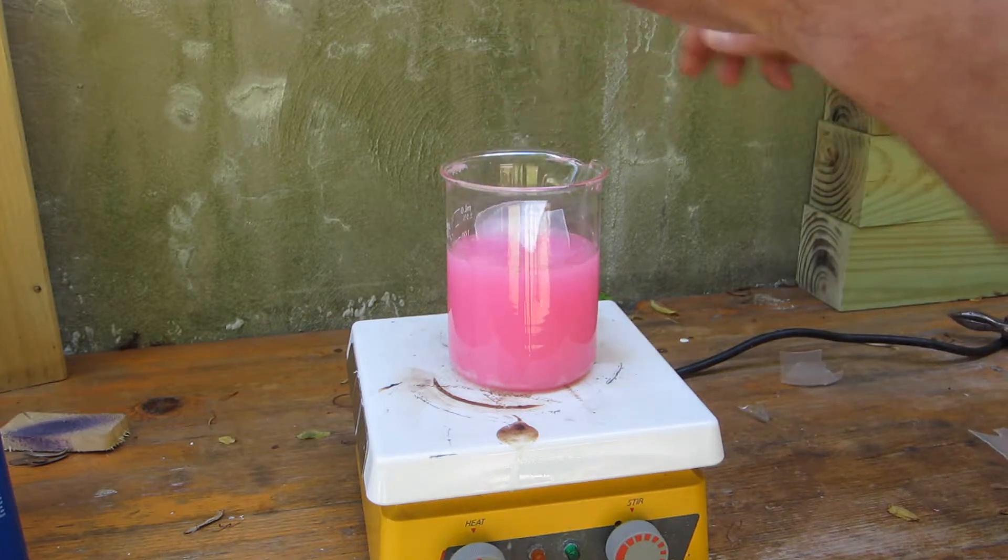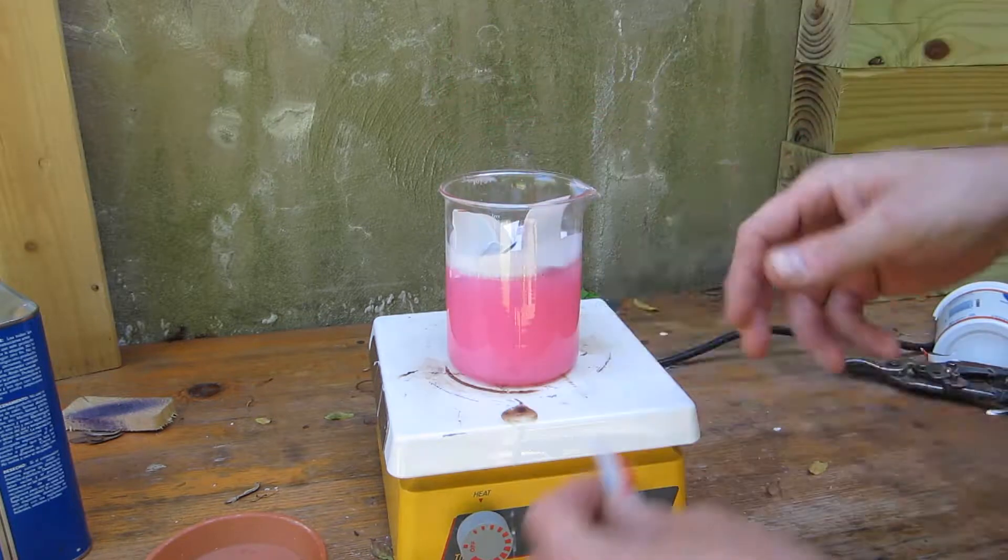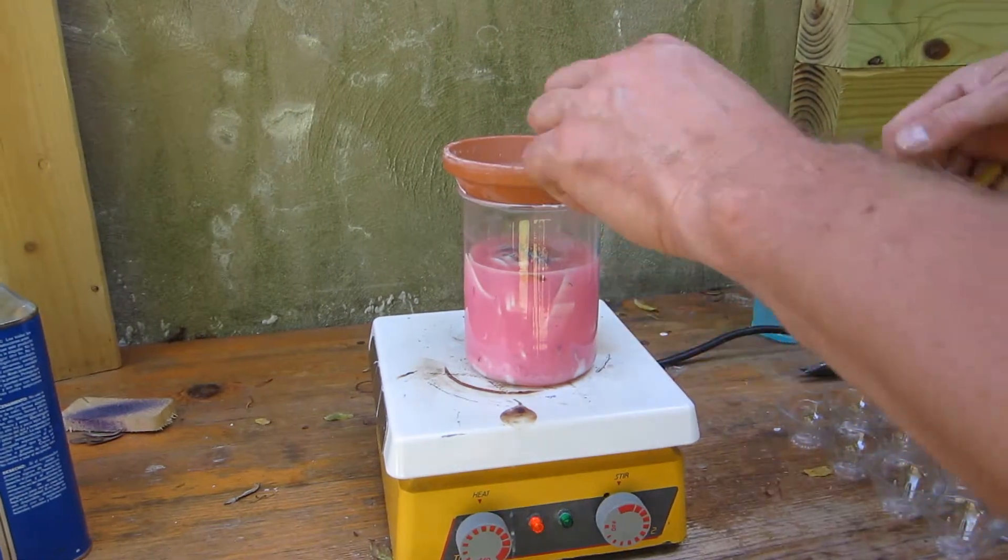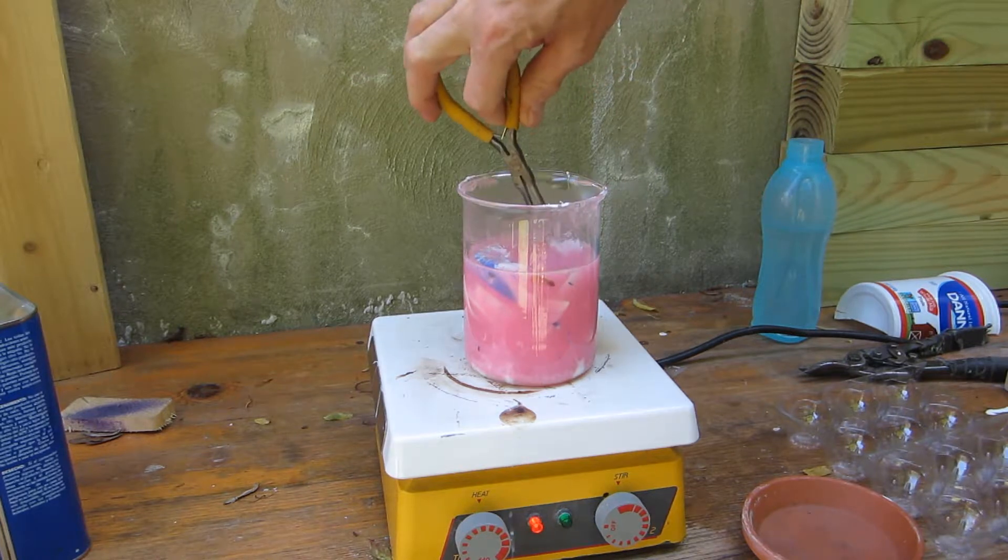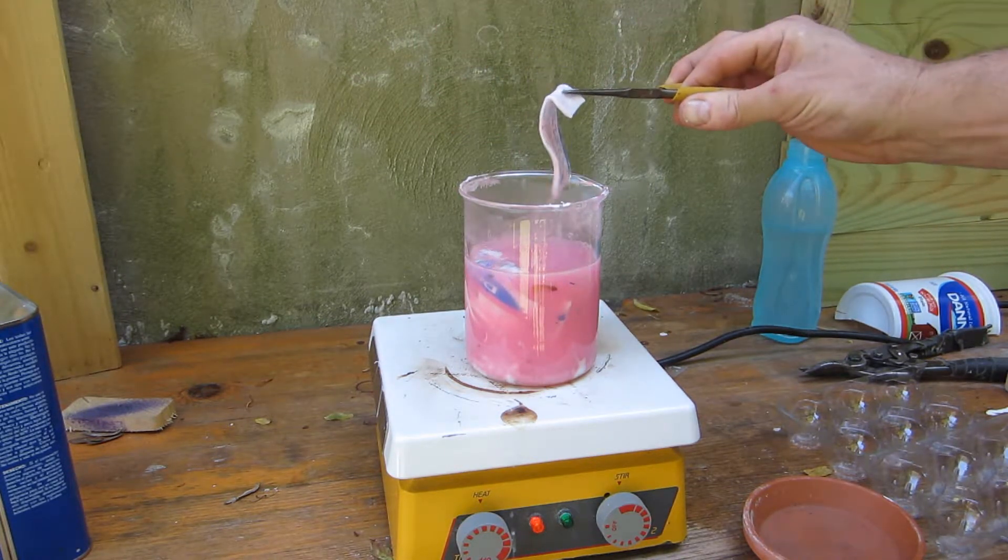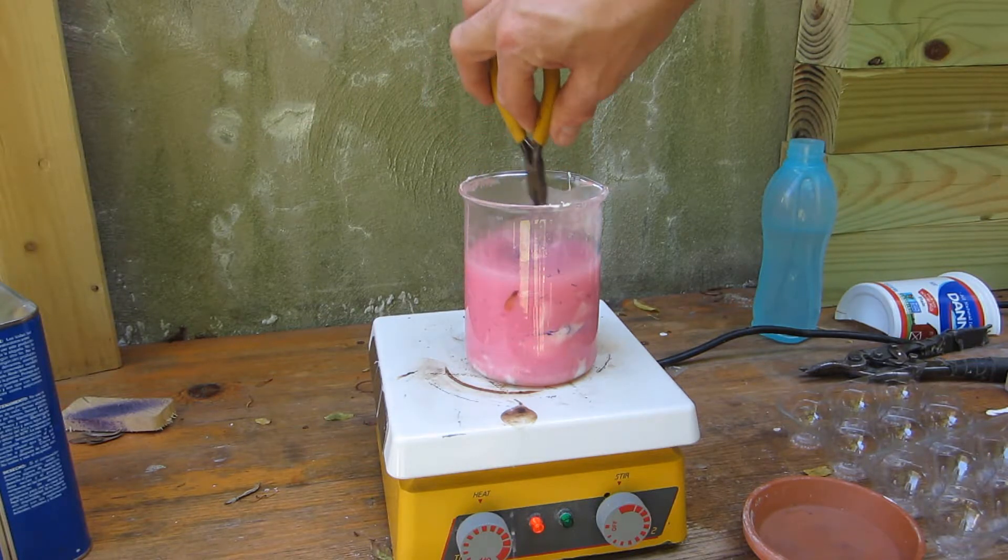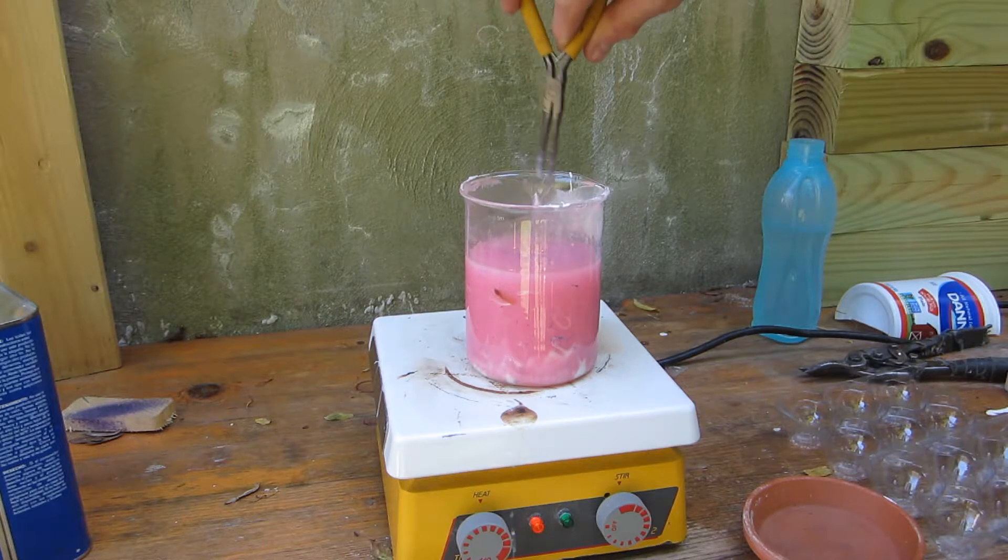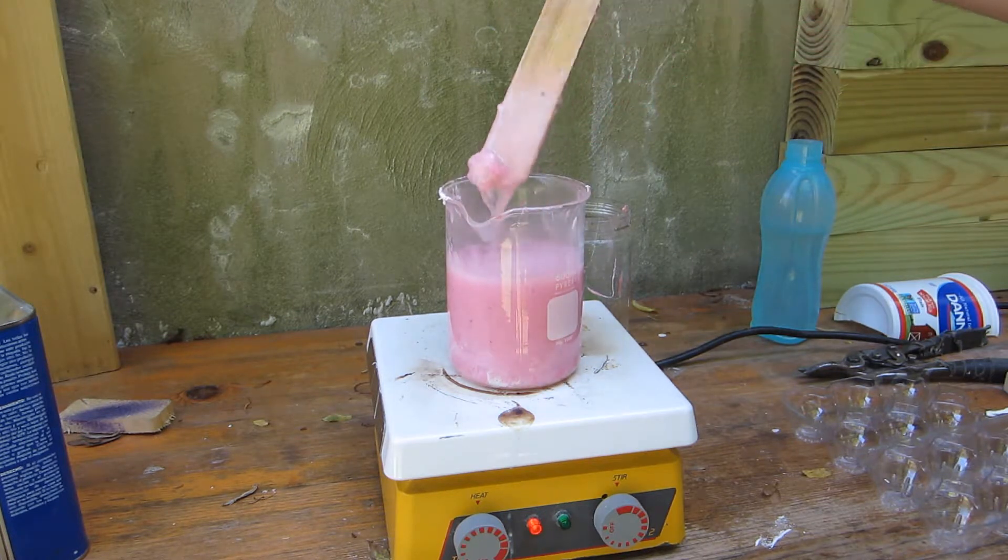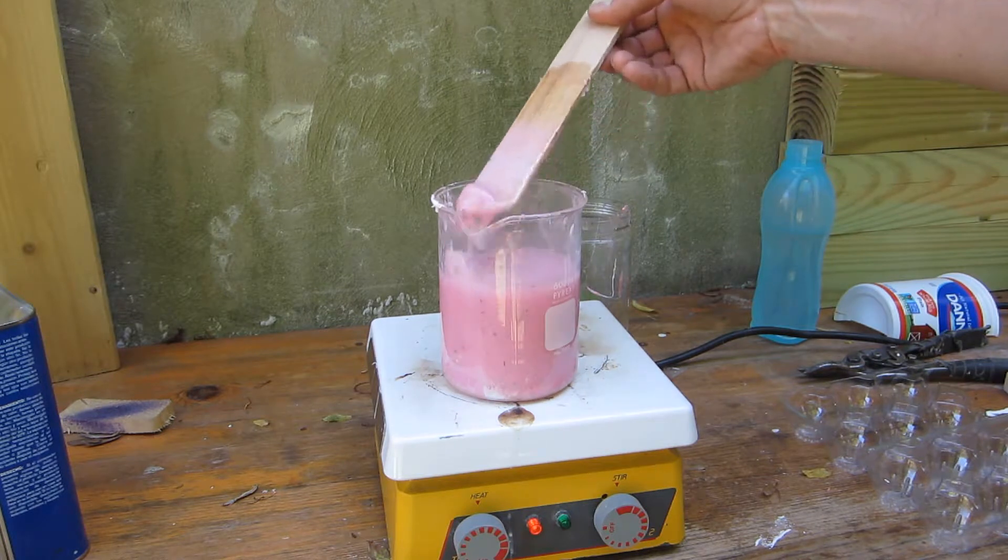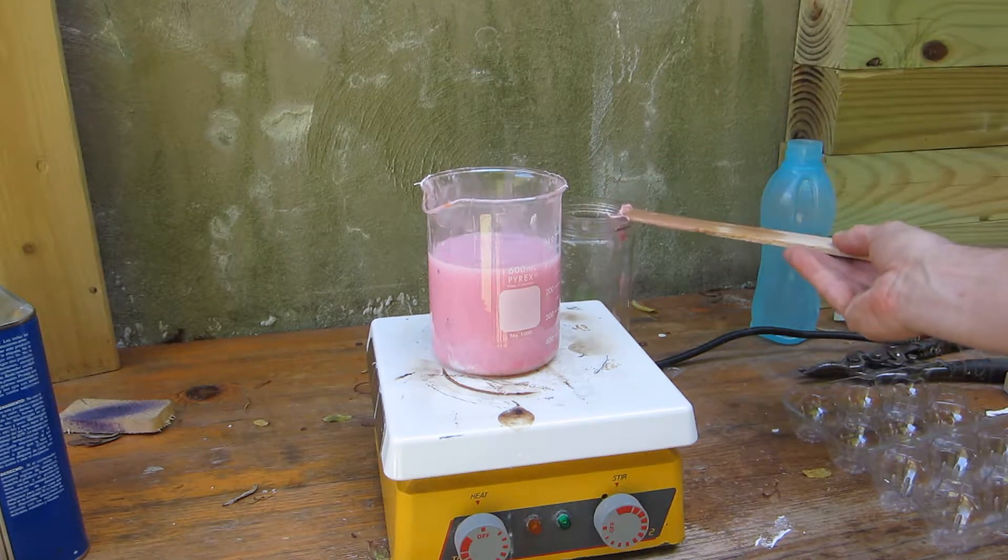Nice, somewhat viscous. We're still going strong here, adding yogurt container and a leaf I guess. I think we've reached supersaturation, I don't feel like we're gonna get any more to dissolve in there. Our last bits are like noodles at this point. I'm willing to wait a little bit more. It's boiling away furiously but I can't get the rest of the plastic into solution at all, so we're gonna call it quits here. It's hyper saturated at this point and it rapidly solidifies, very quickly.